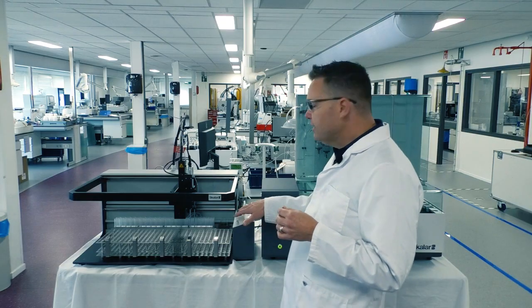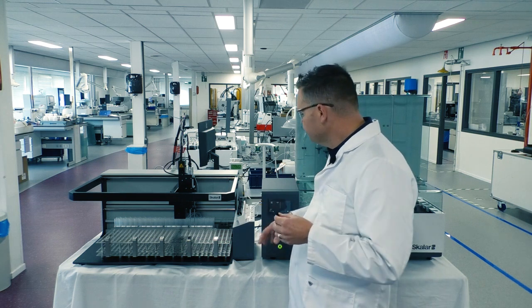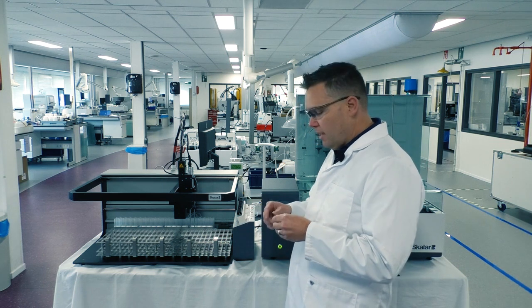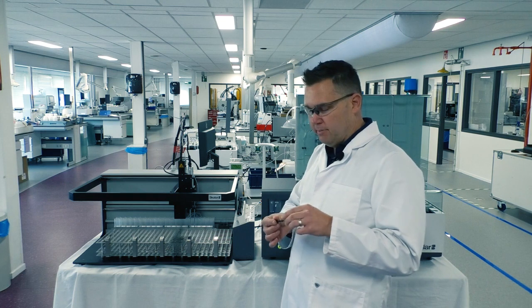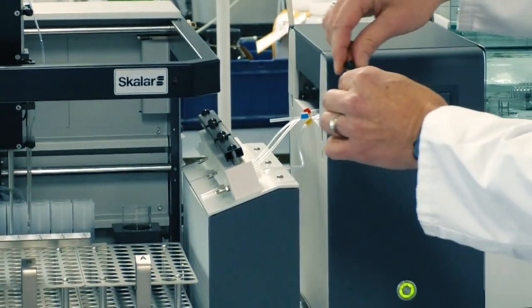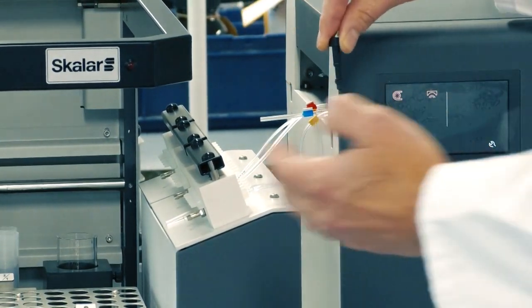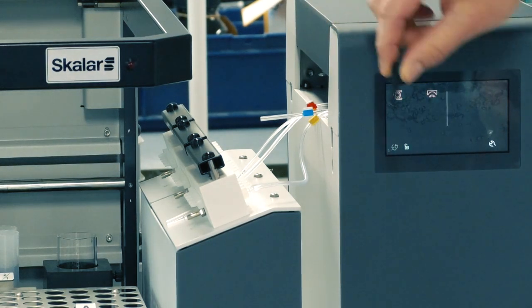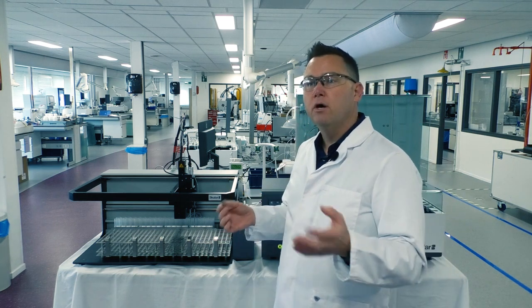They're mainly maintenance free. So once a year we recommend on your PM visit by a Skalar engineer, or your users can do it themselves, you remove the tops of these valves, and these little plungers come out, and there's a series of O-rings that we replace annually to make sure that they're sealing really well as they slide. Because in essence, if you can visualize, they're just pulling these rinse valves up and down to divert the flow from reagent to DI water to rinse the system out, and then vice versa. So that is how we truly basically shut down our system and leave it running overnight while we're home enjoying our afternoon.